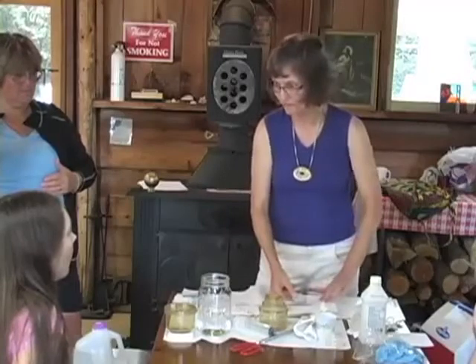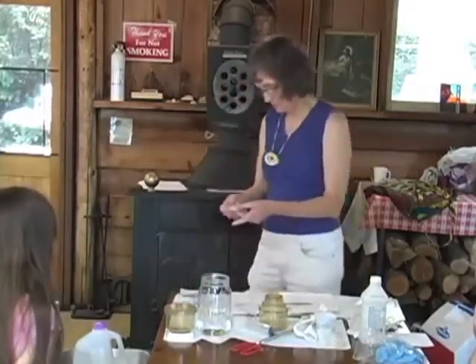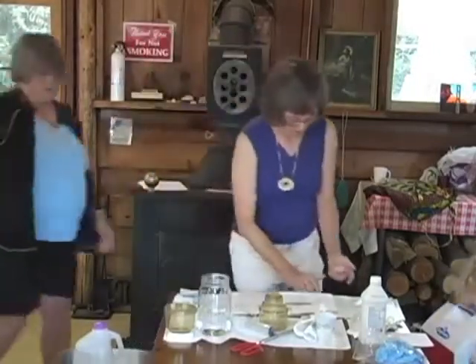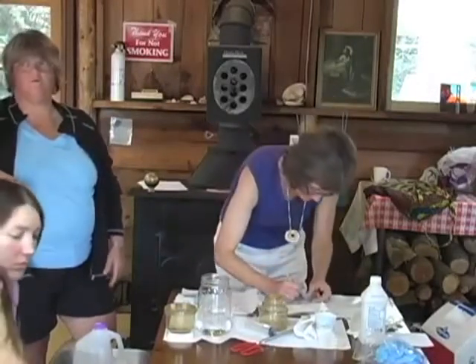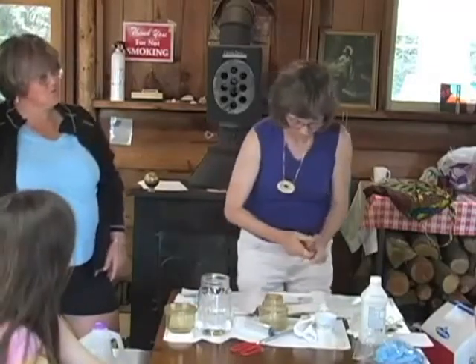Label the petri dish with the stream or site, the marker, and the amount of water filtered. So when you turn it upside down to put it in there, yep, that's what we want. B for blank, or BL for blank. Blank is our test one. That's the control. We expect it to be 0. If it's not, then we know we screwed up someplace.